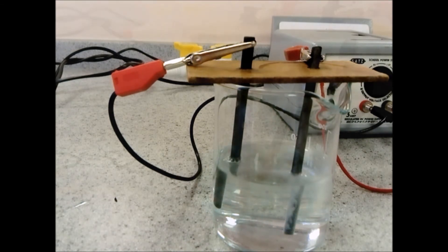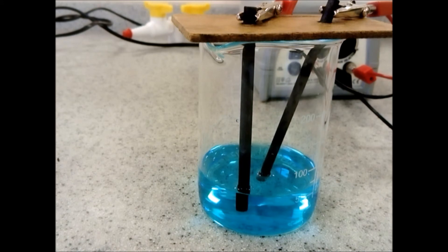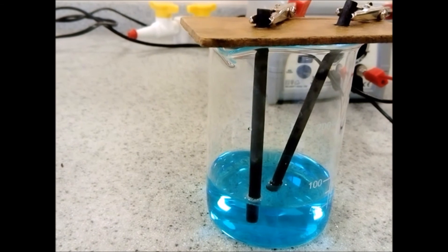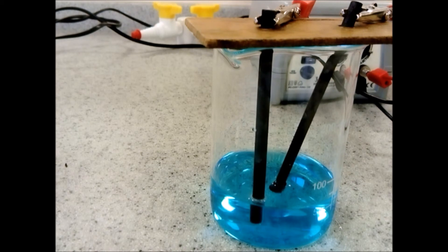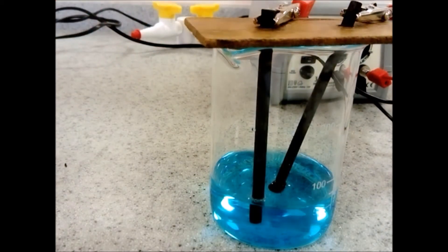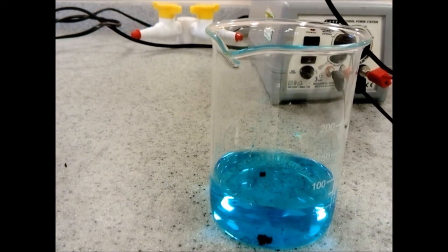The final electrolysis is that of copper chloride. Remember you're going to form positive copper ions and negative chloride ions. When we turn it on, you can see chlorine gas forming at the positive electrode. At the negative electrode, when we take it out, we can see that copper has formed — some fell off into the solution but copper is clearly deposited.